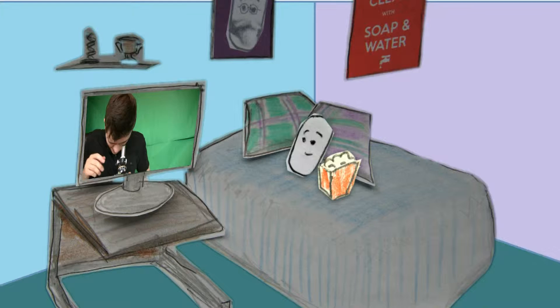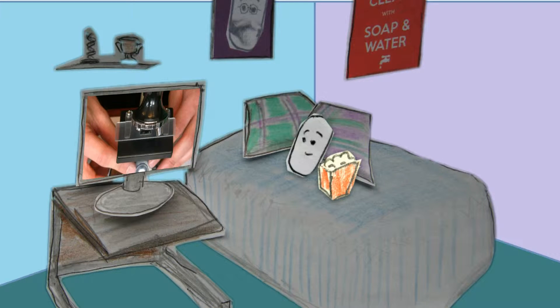My first slide is going onto the microscope stage. Now let's have a look. Oh, we need the light on. There we go.